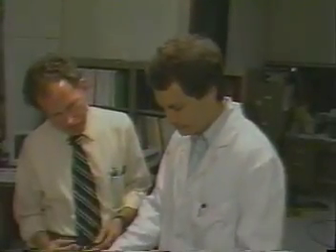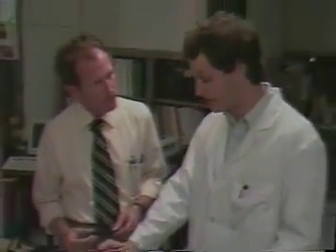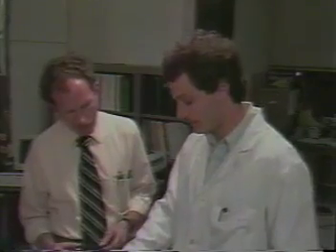Let's join Tom in the laboratory now as he picks up some scatter distributions from the printer and explains his analysis strategy to Ken Alt. Actually, Keith queued these plots out of our scatter distributions, and they're quite nice. I had to leave the room during the data collection, so I kept the scatter gates fairly broad open.